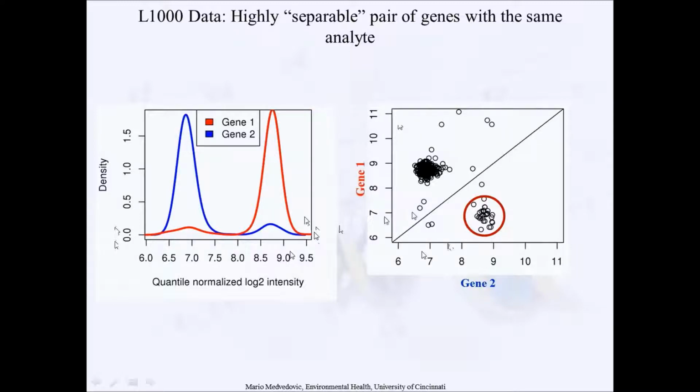But then if you look at them in this scatter plot, it becomes even more obvious, because it turns out that these outlying observations for the two genes were measured on the same bead. So not only do they behave like gene 1 here and gene 2 for the other one, but they're observed on the same bead. So a simple flipping event in which we accidentally called or mislabeled gene 1 and gene 2 in this deconvolution process would cause this exact data behavior. And that kind of gives us likelihood for this happening by chance, or probability of this happening by chance seems pretty low. And this is most likely, at least we concluded at that point, the problem with the deconvolution.